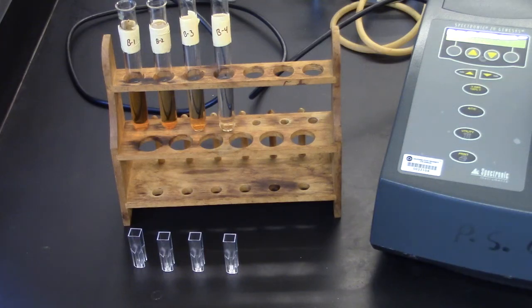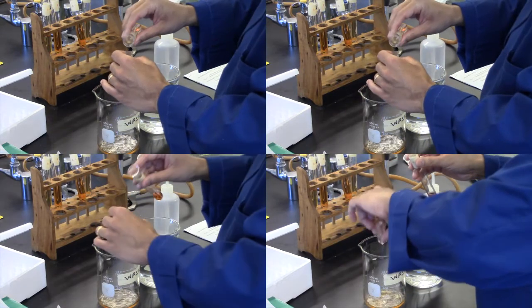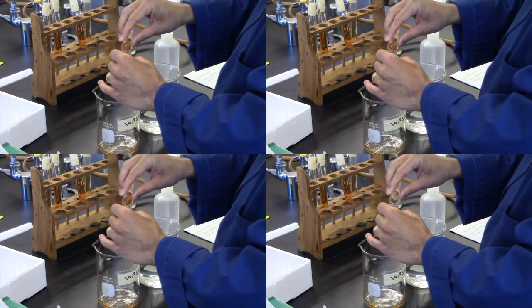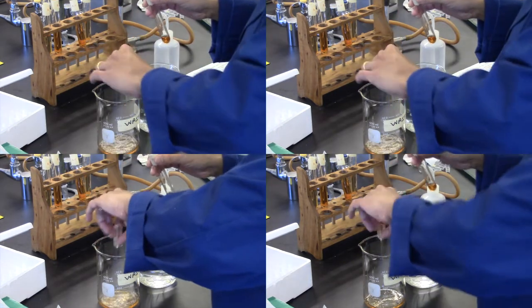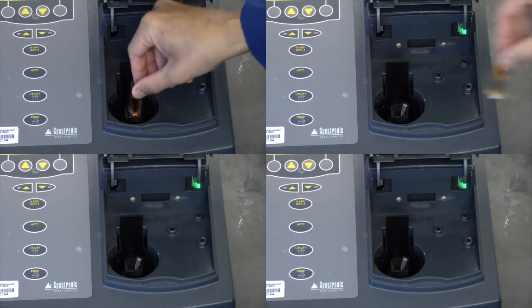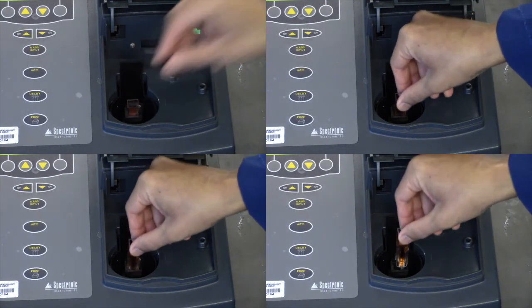Prepare four cuvettes. Remember to rinse each cuvette three times with the sample that will be used in it. Measure the absorbance of each of the solutions and record the values.